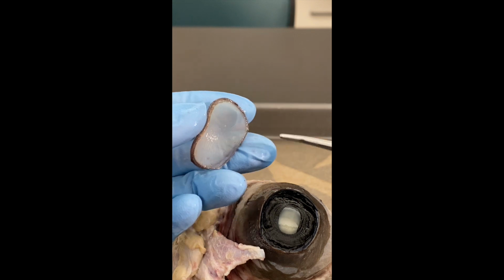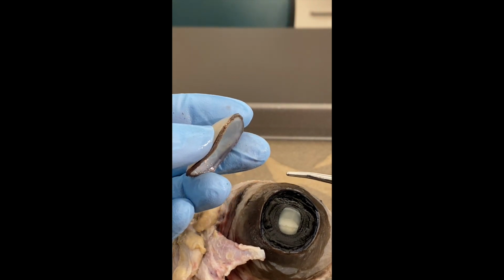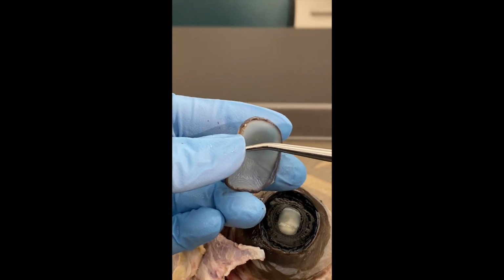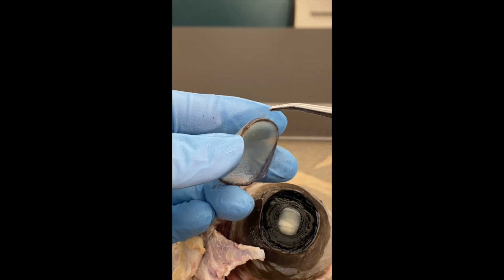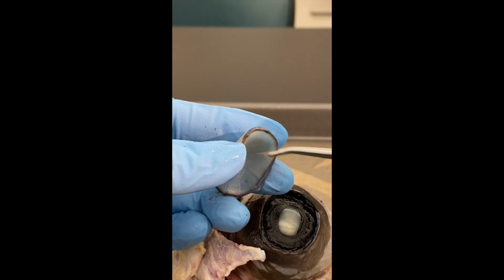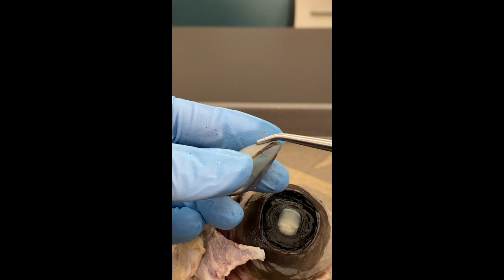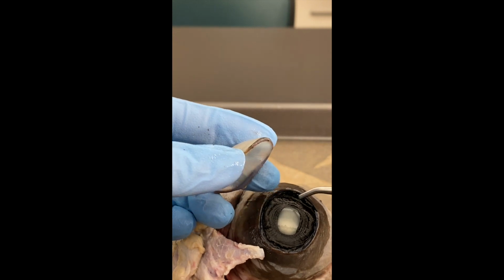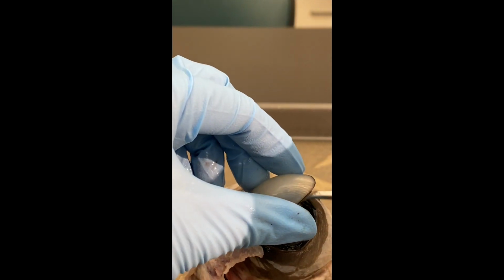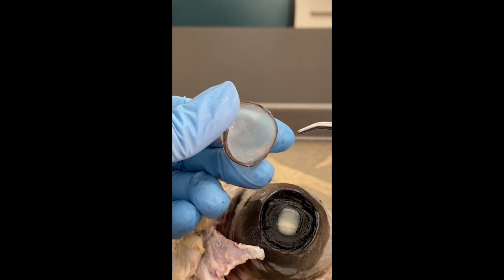So if you think of it like looking at the face of a clock, you've got glass that covers the face. That would be the cornea. And then you get a space that's in between the glass of the clock and the face of the clock. That space between the two would be what we refer to as the anterior chamber. So again, cornea, iris, and the space that runs in between the two is called the anterior chamber of the anterior cavity.